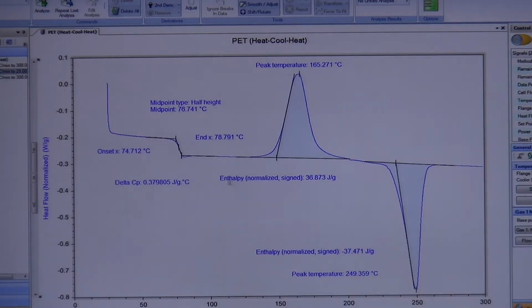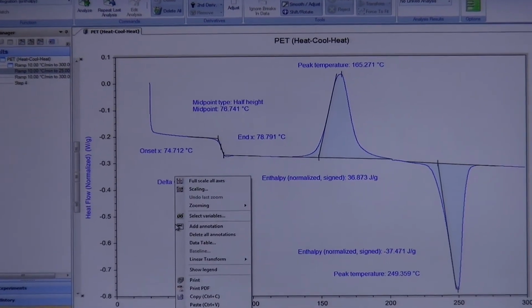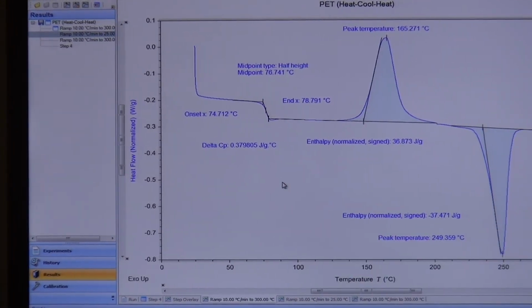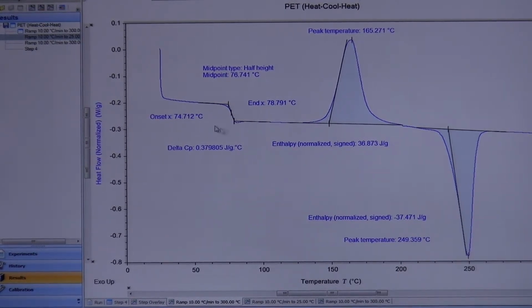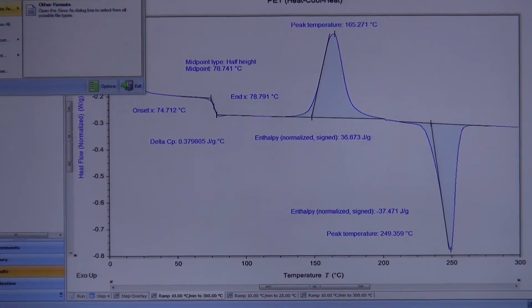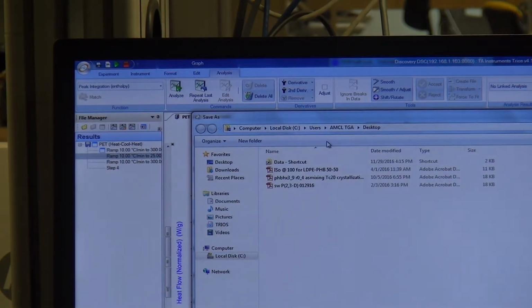Now I'm done doing all the analysis and all that stuff. I want to save all this because this could be a lot of work. One thing that's really nice is that you can actually right-click and simply copy these graphs. You can copy and paste these graphs directly into PowerPoint. If you have a group meeting or some very quick presentation, you can simply copy everything on there. If you want a better saving method, go all the way up to the top left and click on this TRIOS icon. You can hit Save As and save it to a PDF. The PDF will save whatever is on the screen, essentially. I'm just going to save it to the desktop for now.